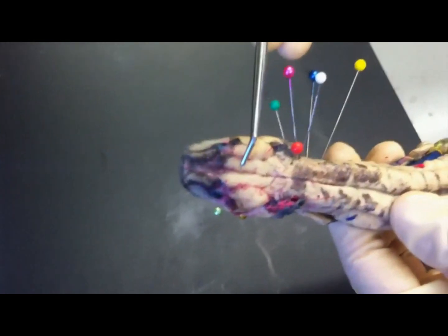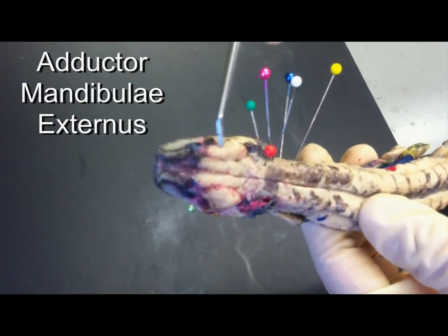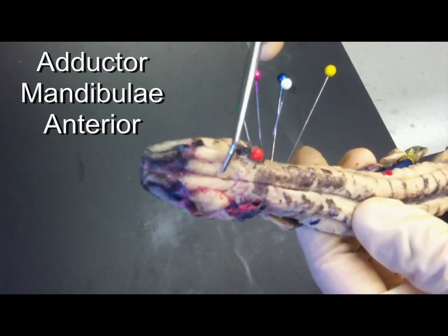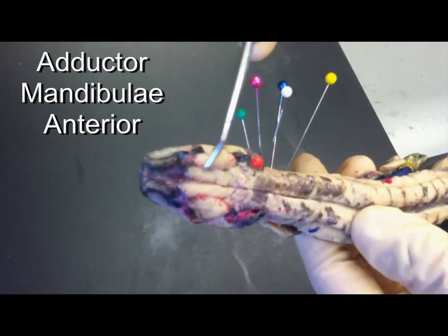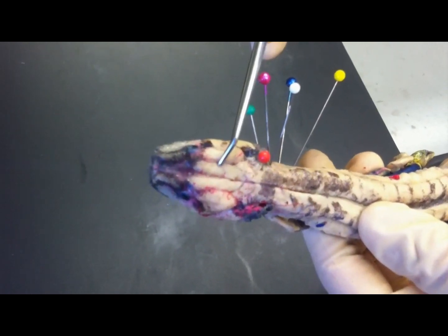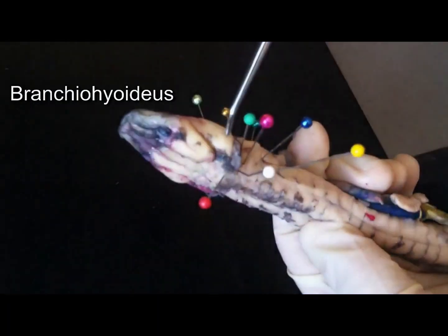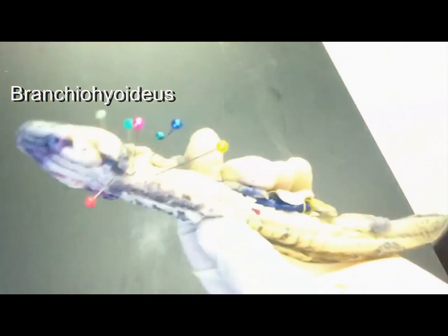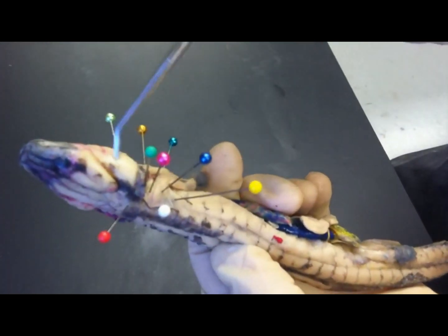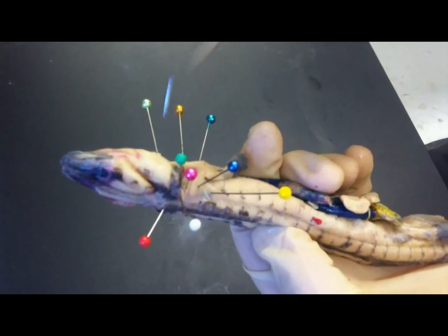We'll go to the top of the head. There are two muscles here: the adductor mandibulae externus and the adductor mandibulae anterior. And then the branchiohyoideus is this big muscle here.